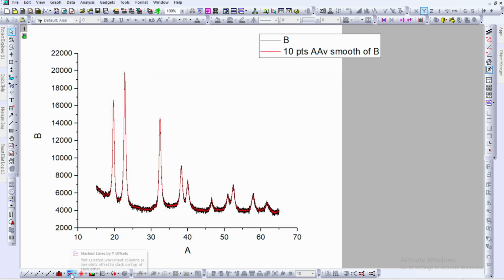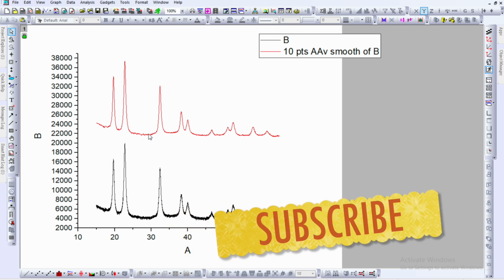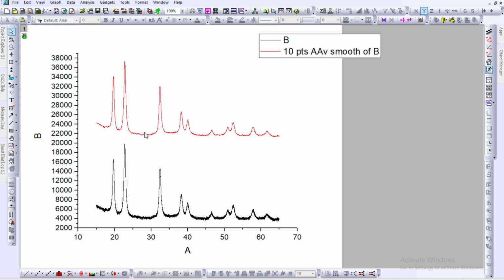Now you can go to the bottom and click on this stacked line by Y offset. It will help you to stack the lines. In this way you can get a clear difference between the original experimental data and the smooth data.